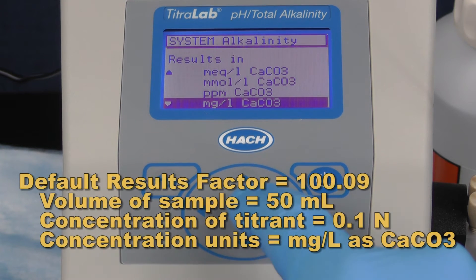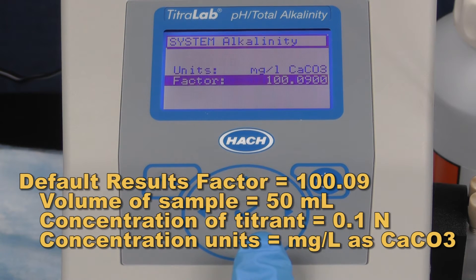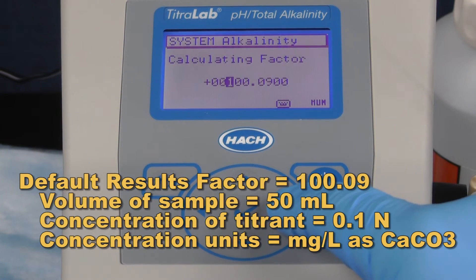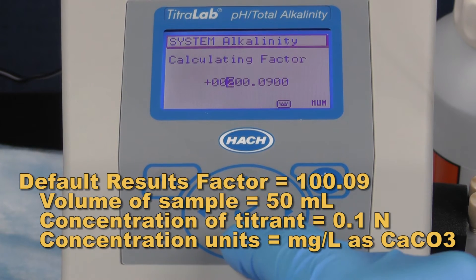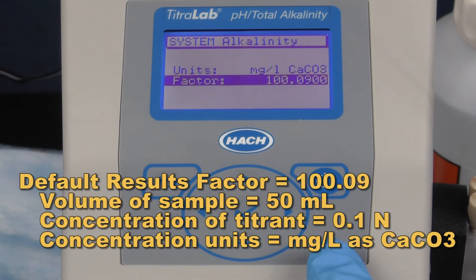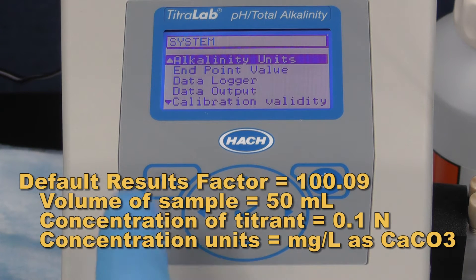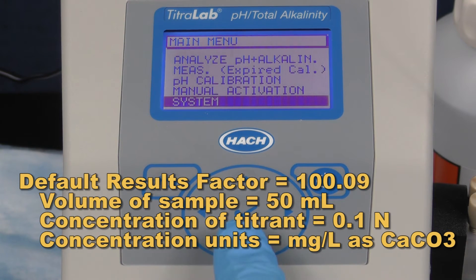The results factor of 100.09 is also displayed and has been calculated using the parameters of 0.1 normal sulfuric acid, units of milligrams per liter CaCO3, and a 50 milliliter sample. If any of these parameters need changing, or if you use a different titrant other than 0.1 normal sulfuric acid, you will need to recalculate the results factor and enter it into the instrument.